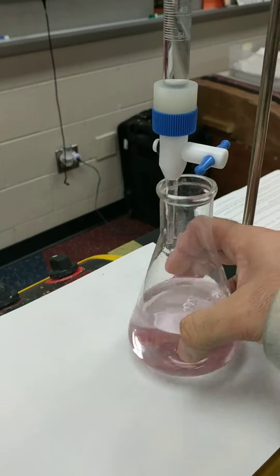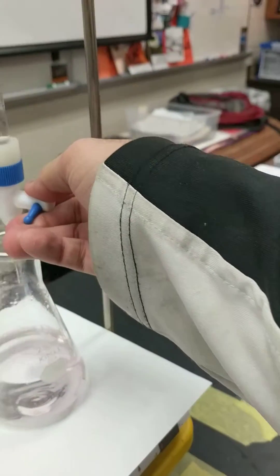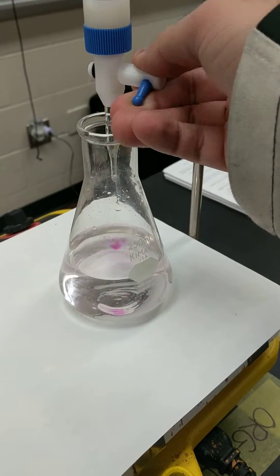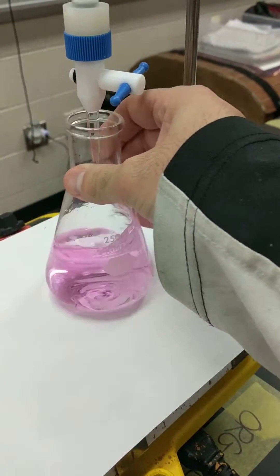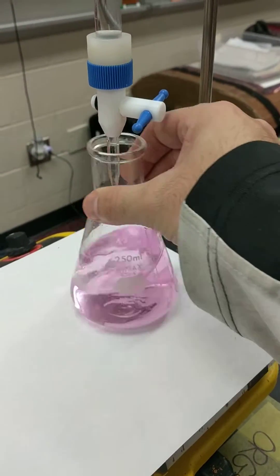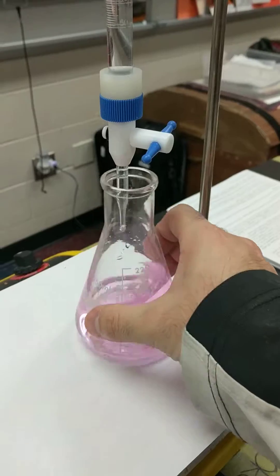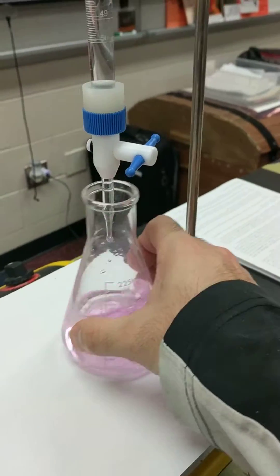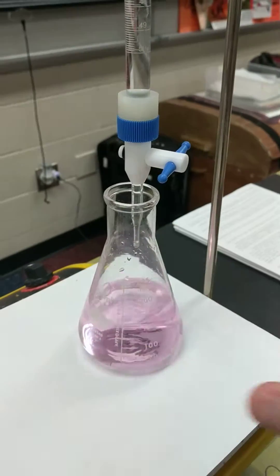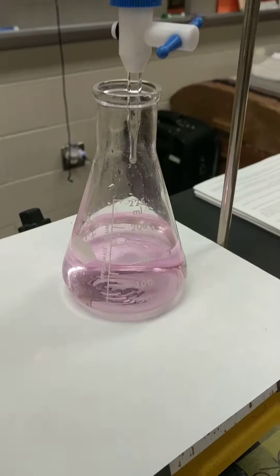Maybe one more drop just to be sure, right? Do you see how I'm starting to get that little pink color here? One more drop. Okay, all right. This is a really good color. This is a beautiful endpoint. That means I've dropped just enough to have all of my base react completely with my acid.